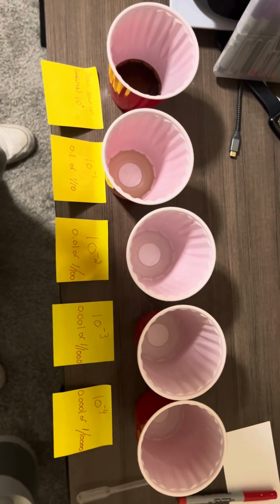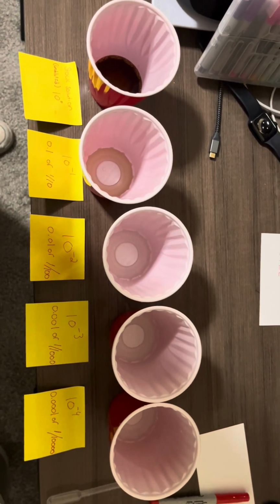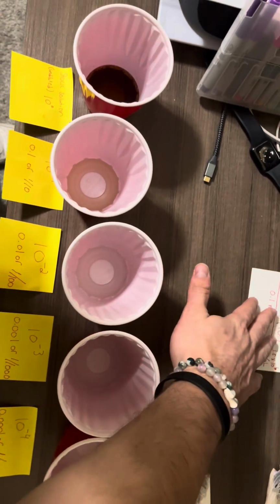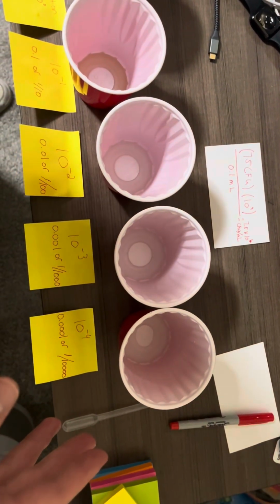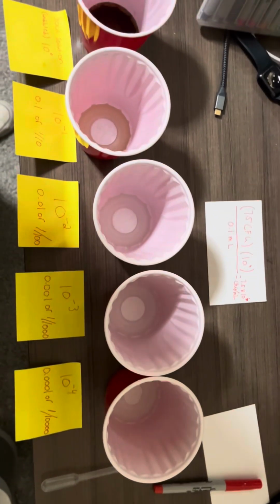From there we're going to do a little bit of math to figure out our CFUs per milliliter. Here we're using an example problem from our final dilution that we used, which was 1 in 10,000, or 10 to the negative 4th.